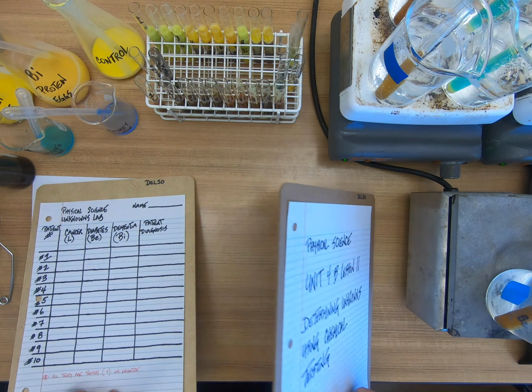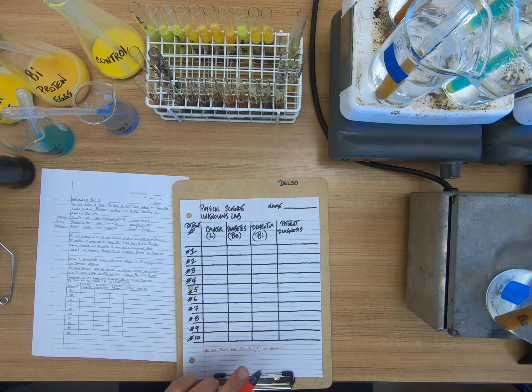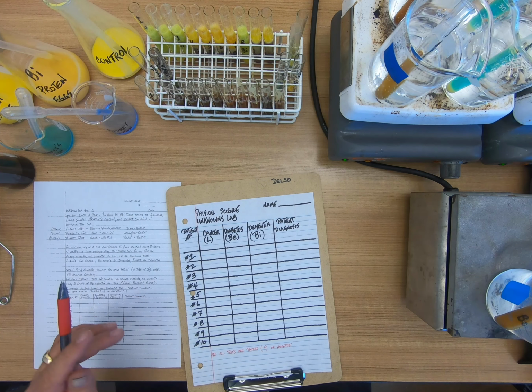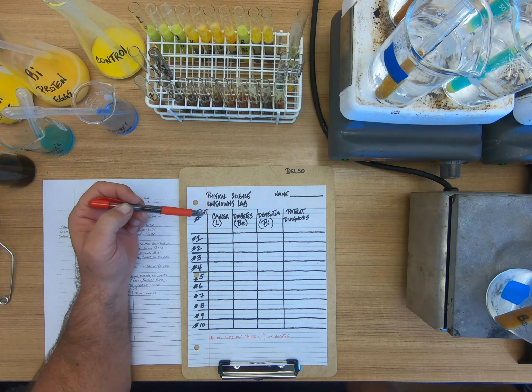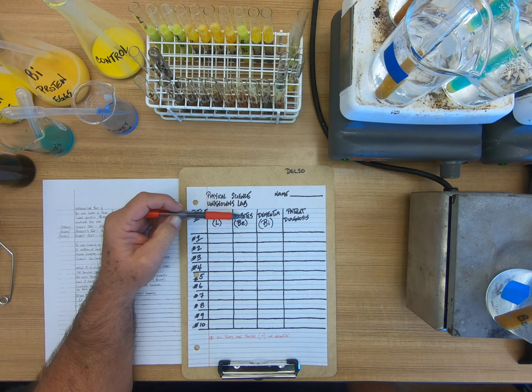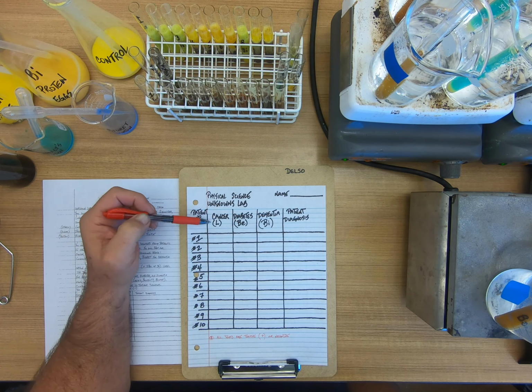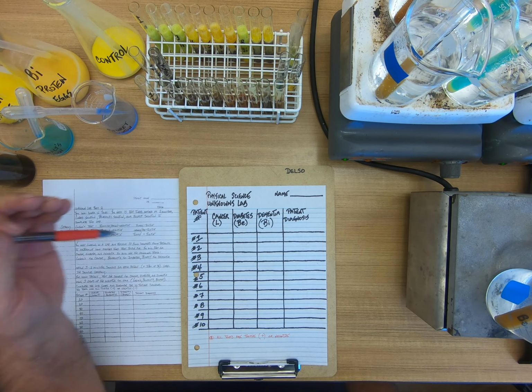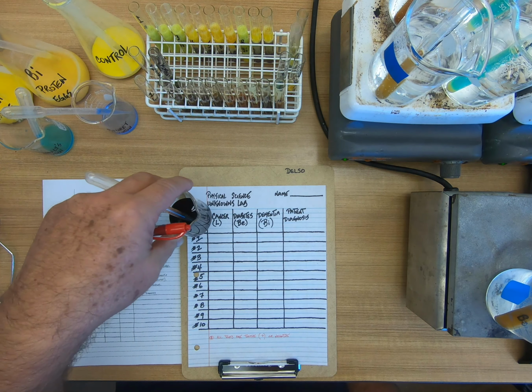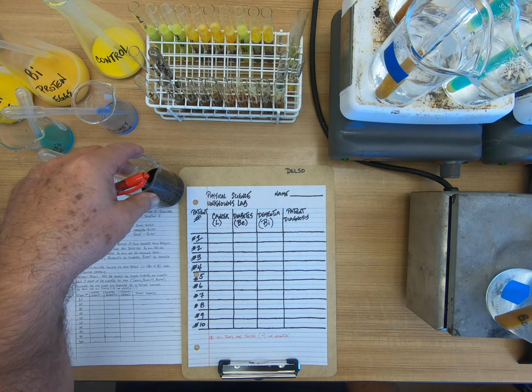We are going to test for three things today. We are going to use 10 patients, and we are going to test them for cancer, diabetes, and dementia. The L, BE, and BI under, L stands for Lugol's, and this is a Lugol's test, and it's an iodine-based test.